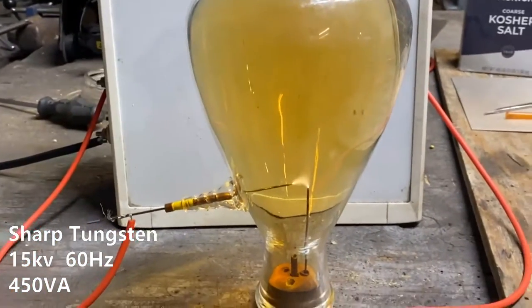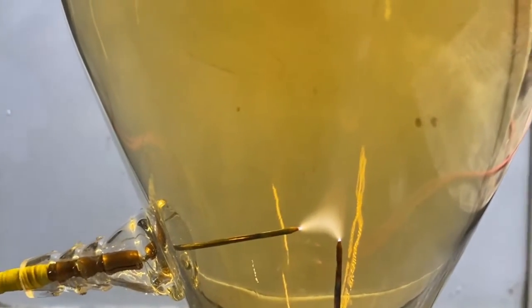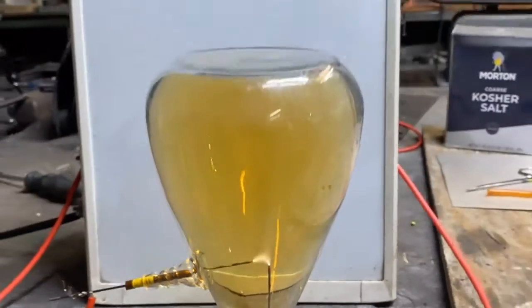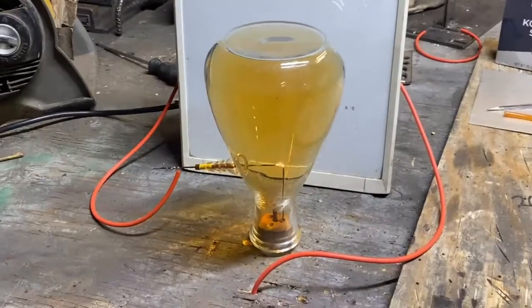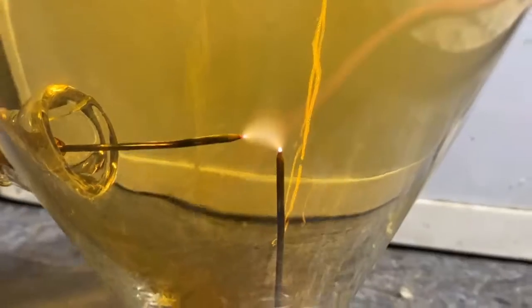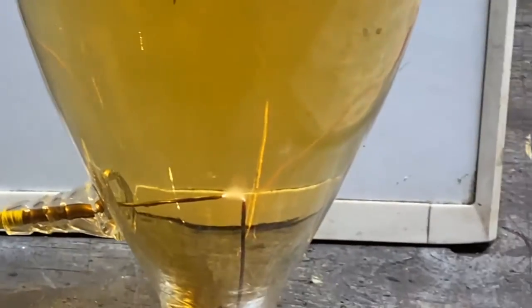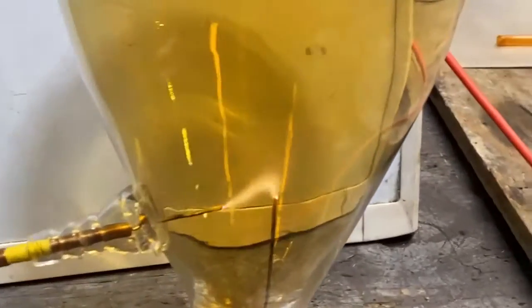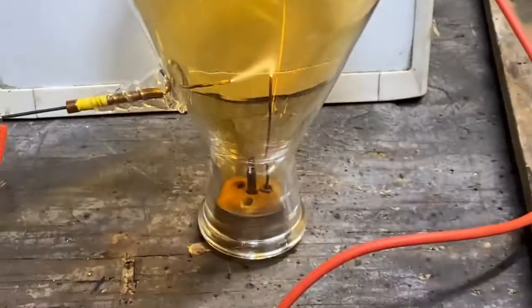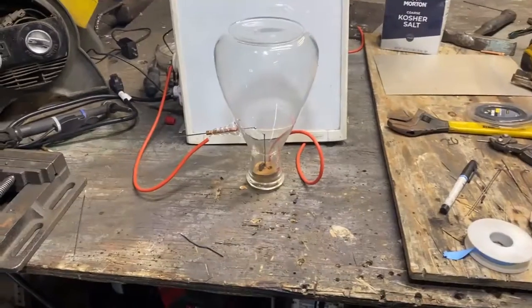Okay, that's a lot tighter. It appeared to be getting a whole lot hotter though — not seeing that smoke plume. There is a little baby arc on it. Let's draw it out now and see what a big arc will do for us. I've increased the arc, but I think I'm convinced that smoke we see is the freaking tungsten tip literally vaporizing away, and that's not going to be long-term sustainable.